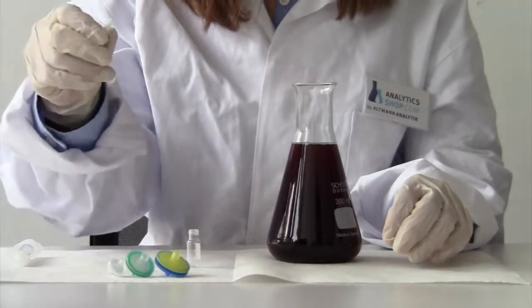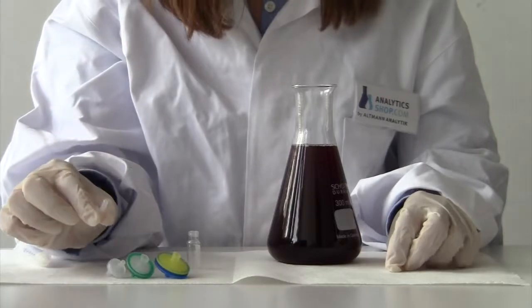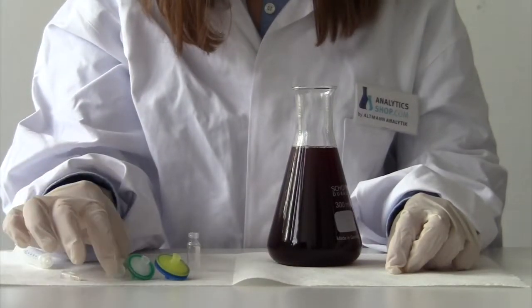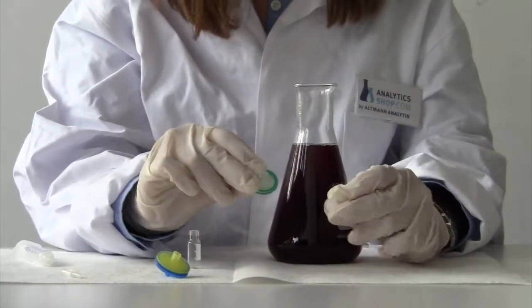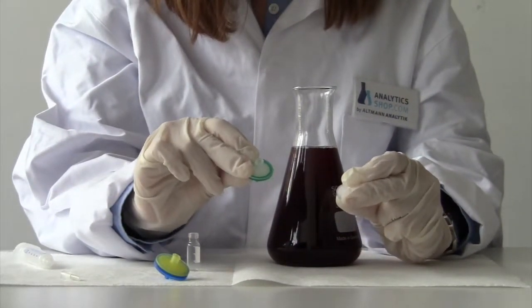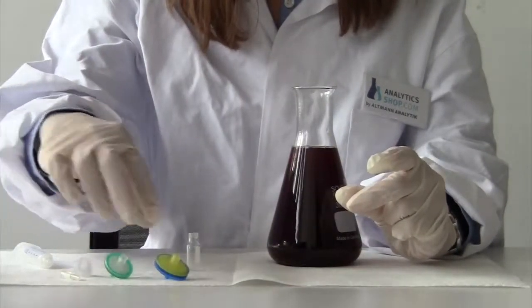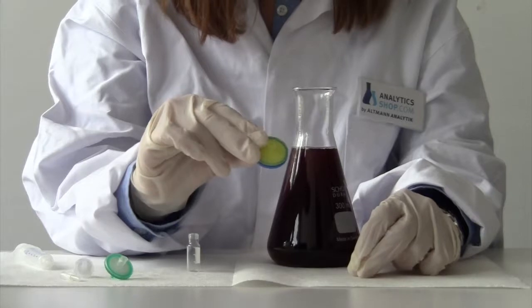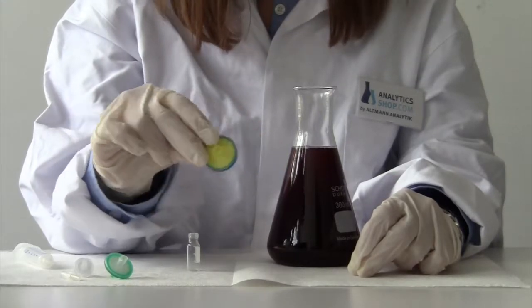For samples smaller than 1 mL, a diameter of 3 mm is used. For 1 to 5 mL, 13 or 15 mm filters are used, and for 5 to 100 mL, 25 mm filters are suitable.